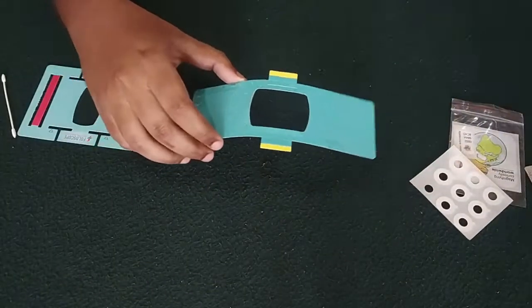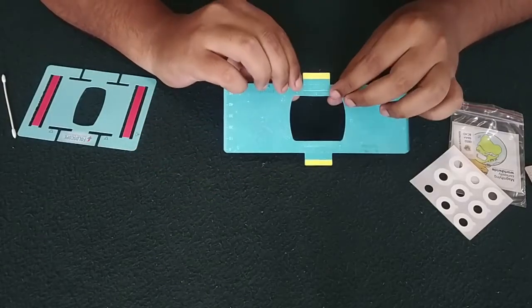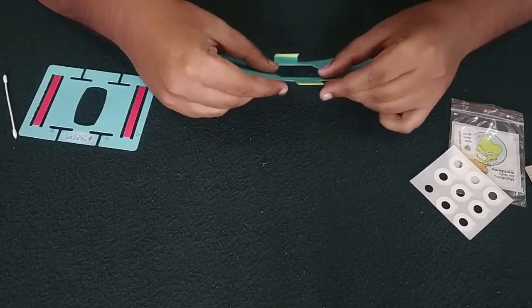Now keeping aside, taking the focus sheet... sample sheet, sorry. Sample sheet, we need to fold it in the same way here also.